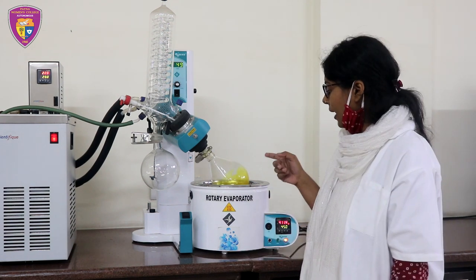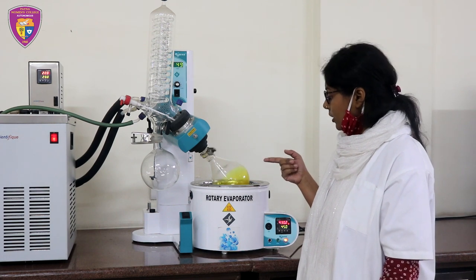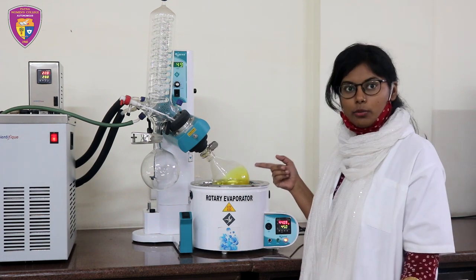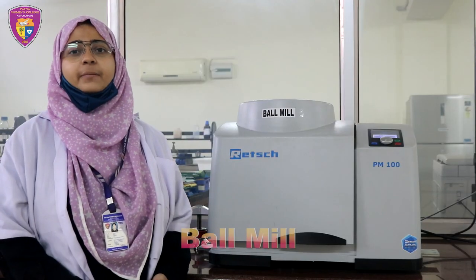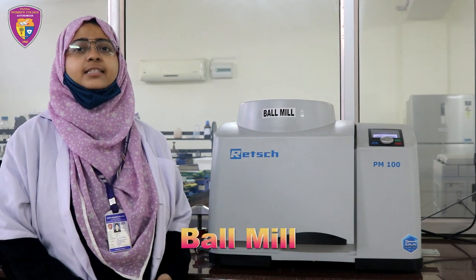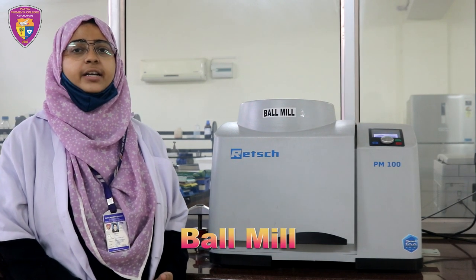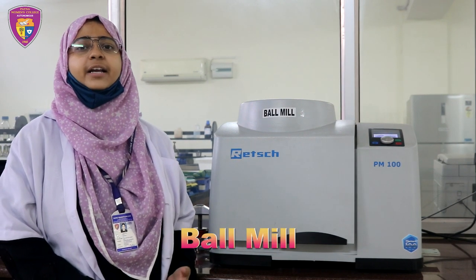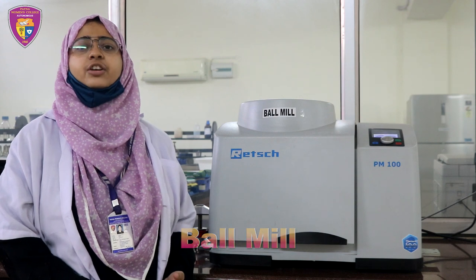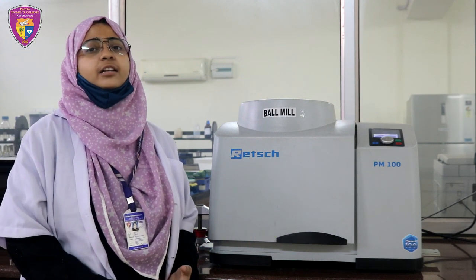Right now I am extracting curcumin from Curcuma longa. A grinding ball mill is a device used to break solid materials into fine particles by cutting, crushing or grinding. Grinding occurs through mechanical force.